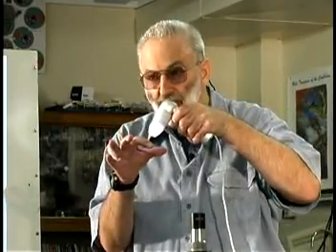Now what I want you guys to do is again take any sample that you want. Again, start with a 50 power lens. Look through the sample and capture several images from each sample. Capture terrigenous sediment samples, if there are some, and then also look for some of the biologic samples and capture them. What we're going to do is use the handheld scope, and the reason why is because it will allow you more flexibility in movement, and you'll be able to see things from the top.